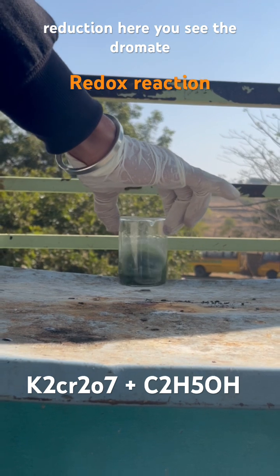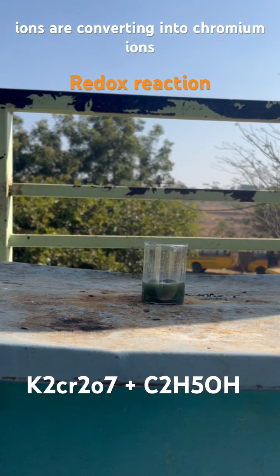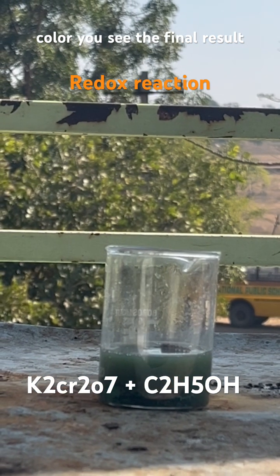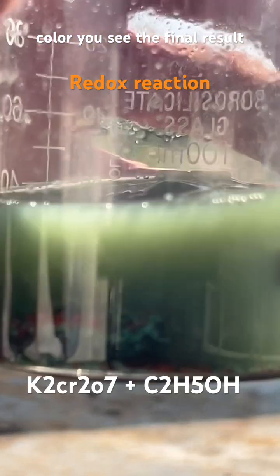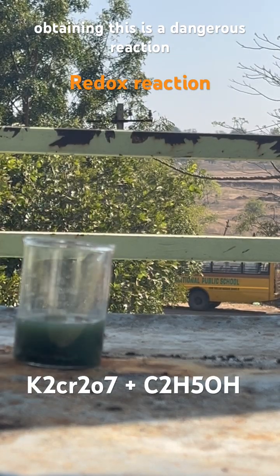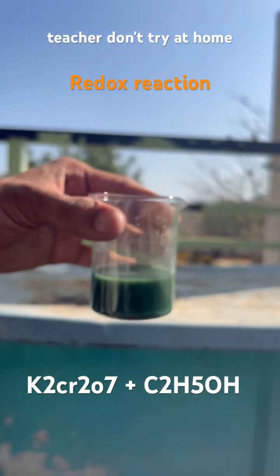In the reduction half-reaction, the dichromate ions are converting into chromium ions, which are green in color. You can see the final result — the green color we are obtaining. This is a dangerous reaction; perform it only under the supervision of a teacher. Do not try this at home.